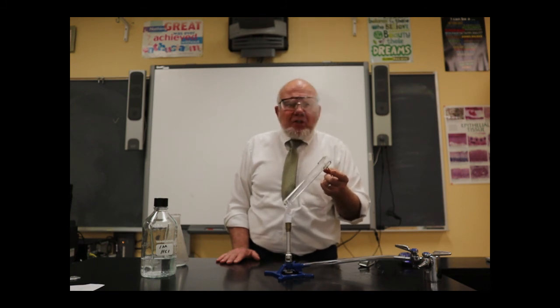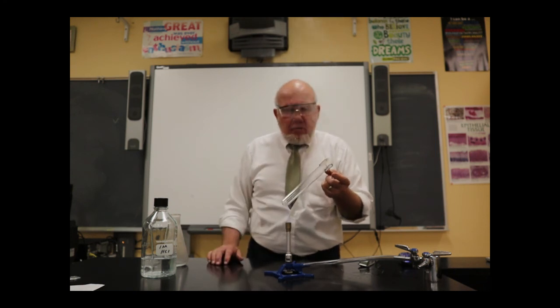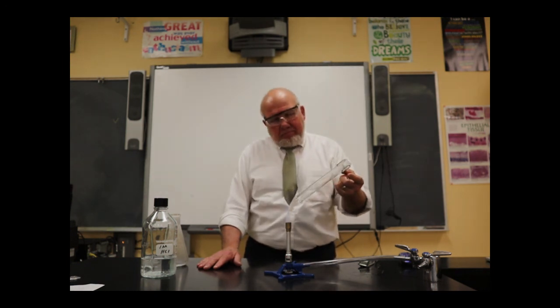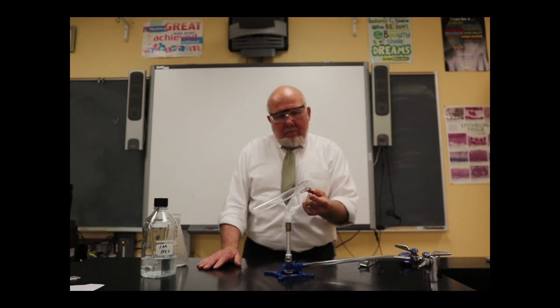My left arm is getting a good workout here. My shoulder, I feel it right here. Really good. I would switch to my other arm, but I'm not very good right-handed. All right, we're getting there. We're getting there. Almost. Oh, yeah. There we go.